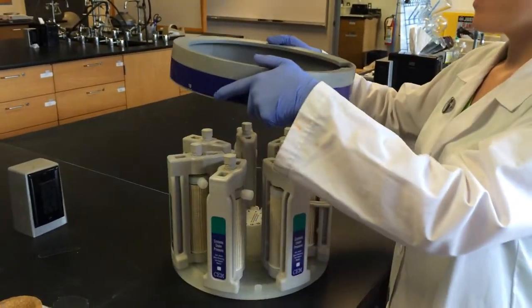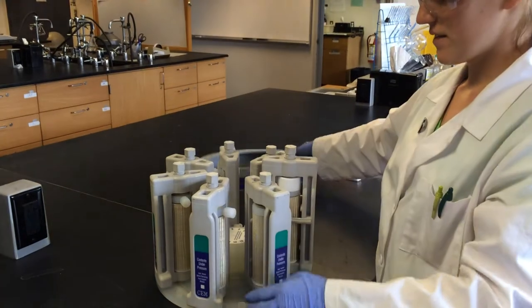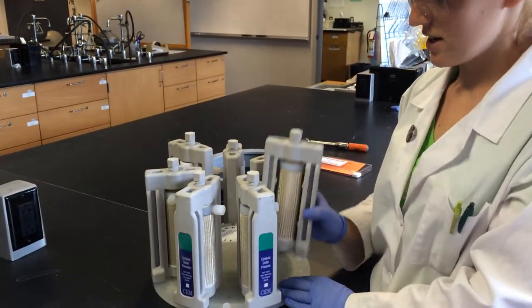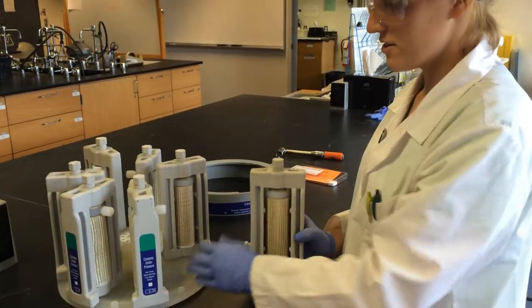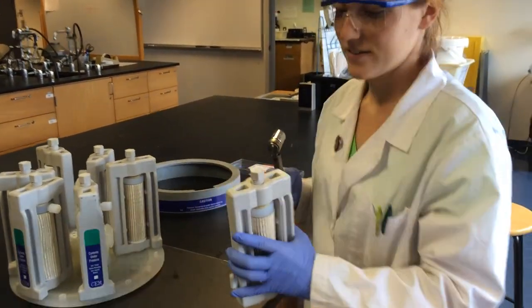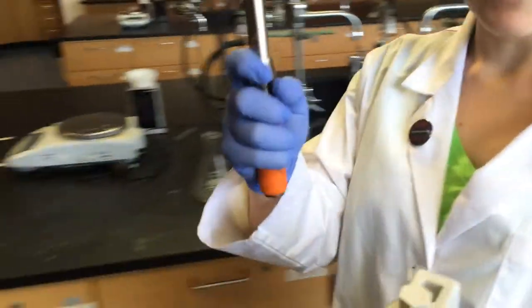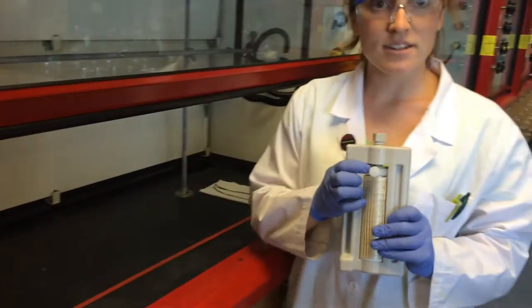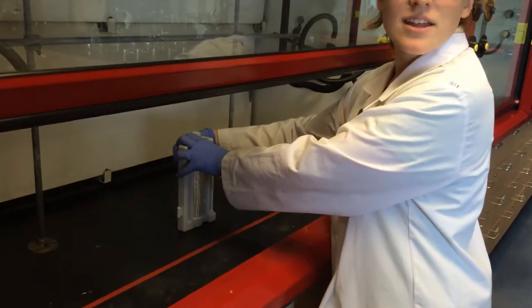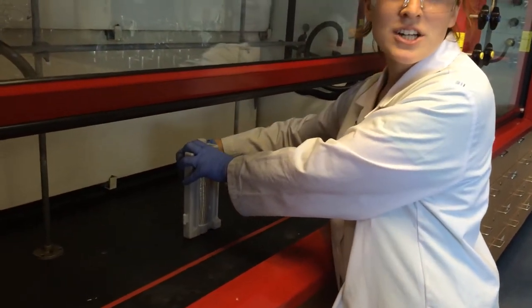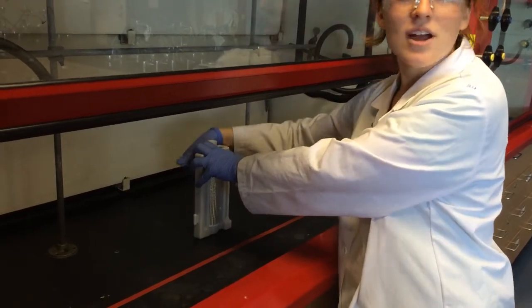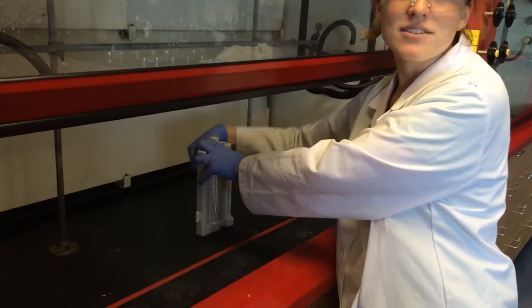You'll need to remove the ring and take out the support module that contains your reaction. And then you need to go to a hood with a wrench and you are going to vent this small white cap away from you inside the hood. This is because it is releasing pressure and if it happens to vent quickly or do other unexpected things, you do not want it to be facing you.